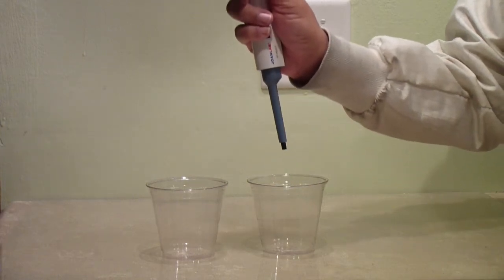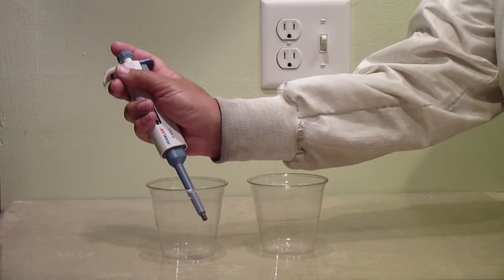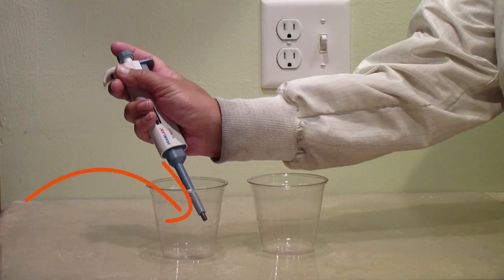Now move the pipette over to a new imaginary container, where you will deposit the imaginary liquid. It is a good idea to touch the tip to the inside wall of the container and hold the pipette at a slight angle.